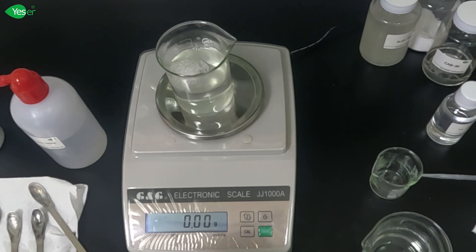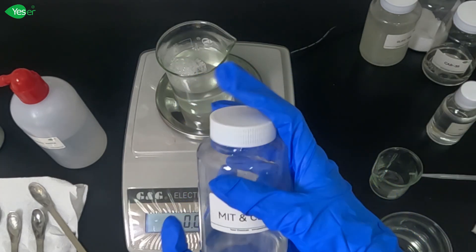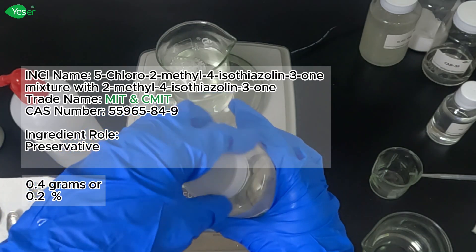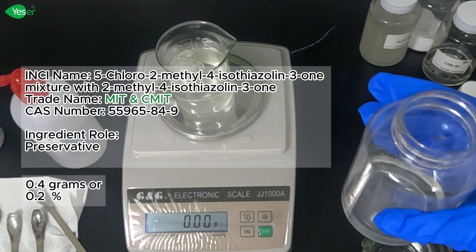Next is our preservative, MIT. Weigh 0.4 grams of this, 0.2% for our formulation.